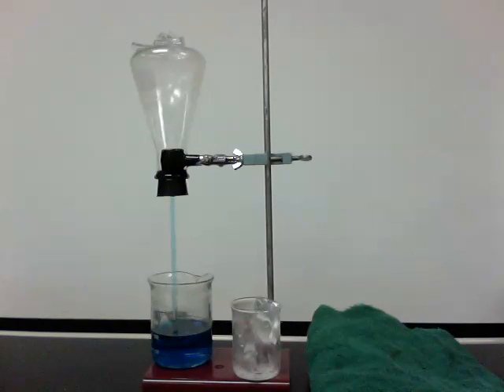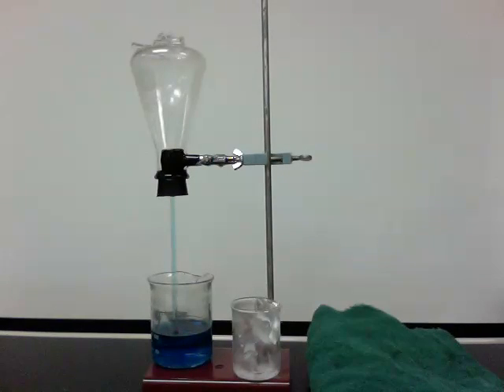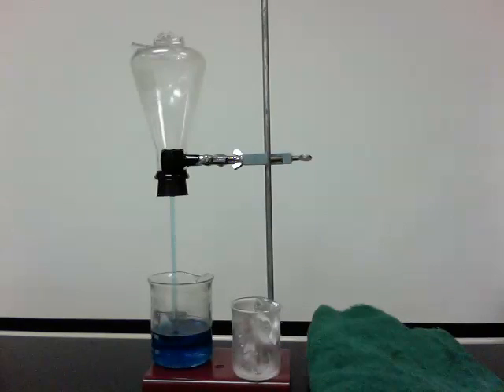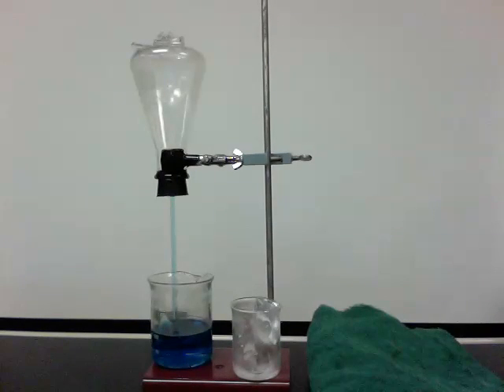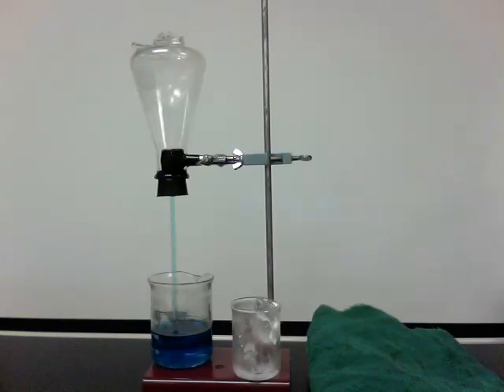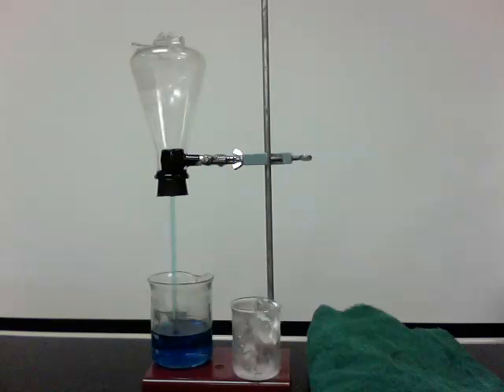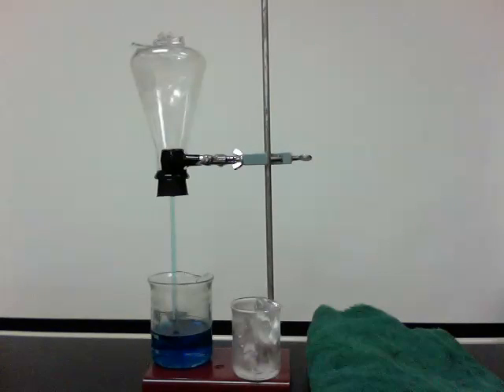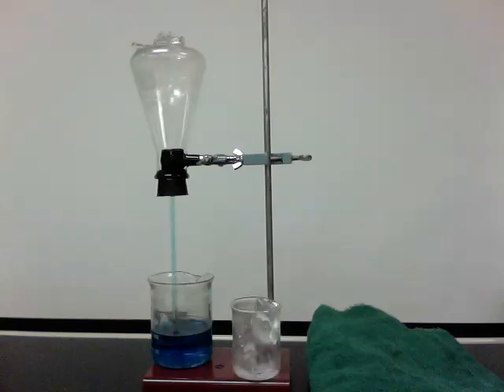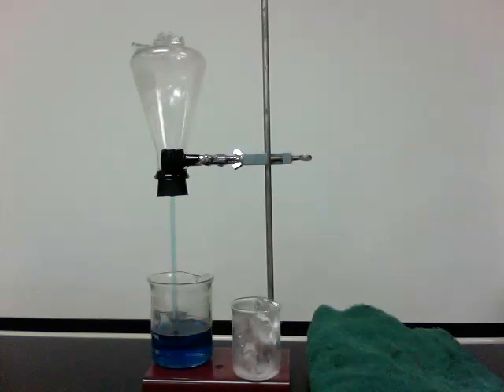In class, students ran this particular trial for about four minutes. I'm not going to run it that long here, but you can see what's going on. From my view, I can actually see water starting to come into the flask — you may be able to see that too.